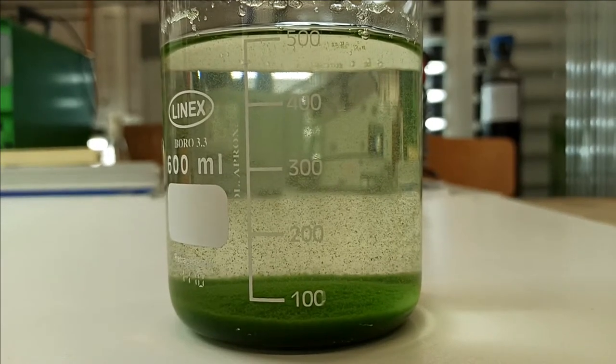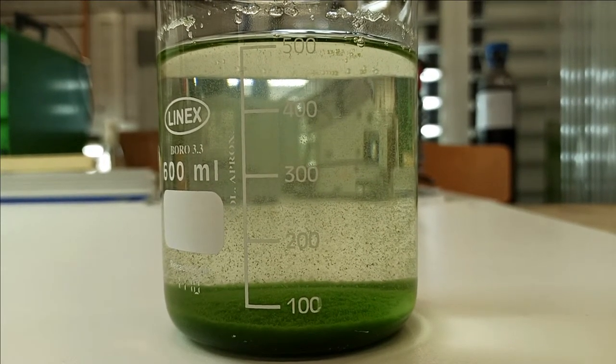You may now collect the concentrate of the culture, separating it from the supernatant and use it for your studies.